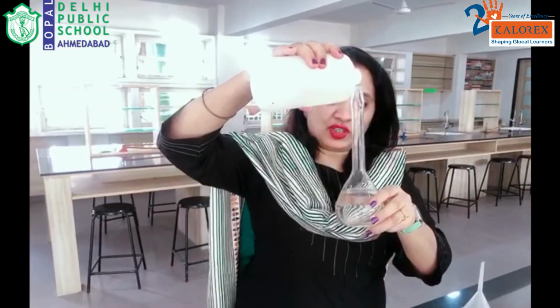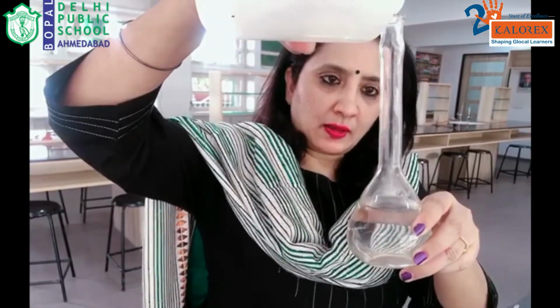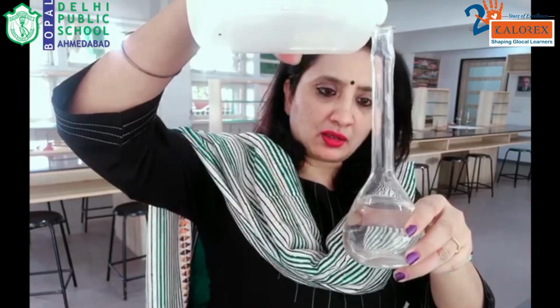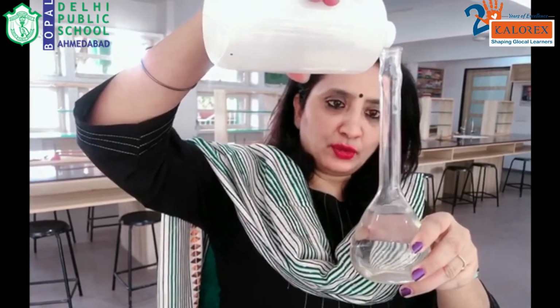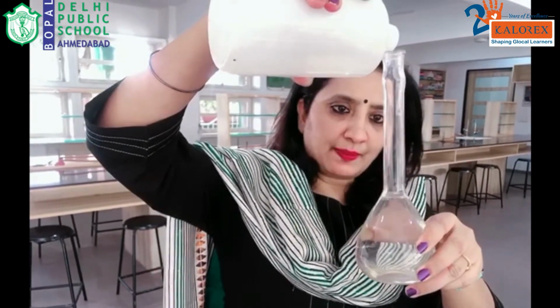As we come towards the end, care has to be taken that the solution is only till the mark. As I go towards the end, I'll start putting in a few droplets in case it's not up to the mark.